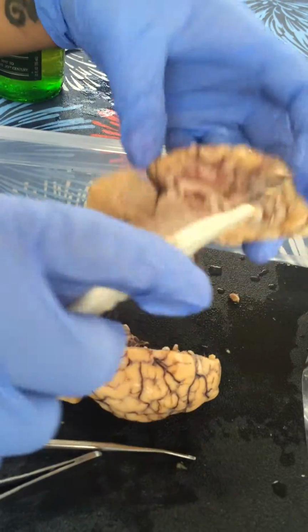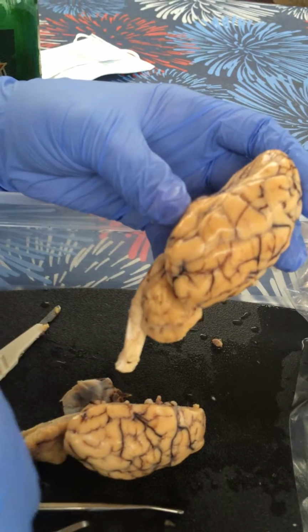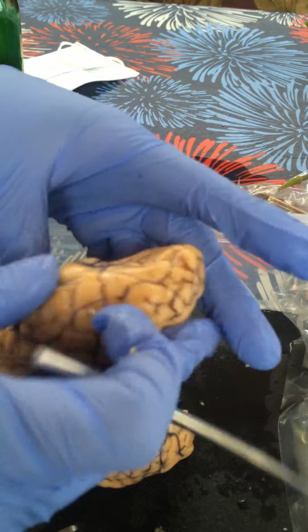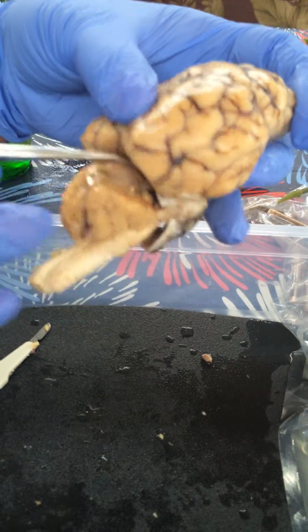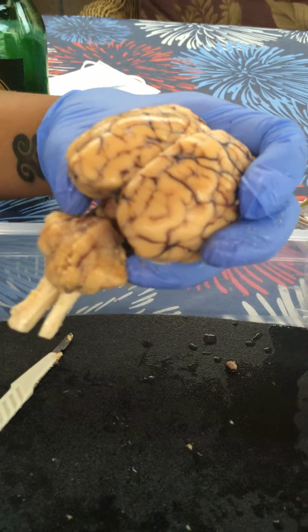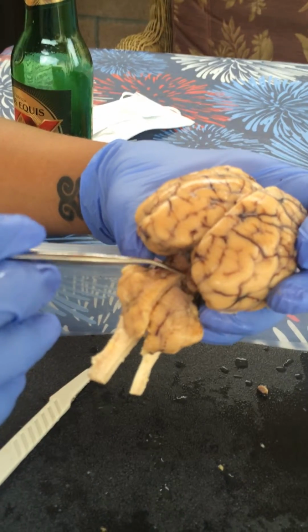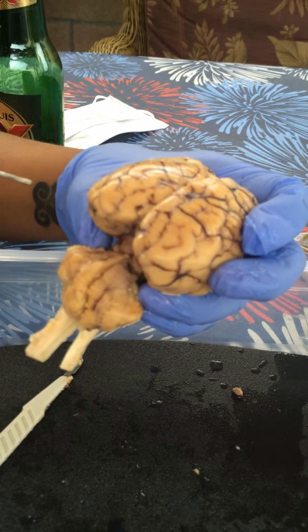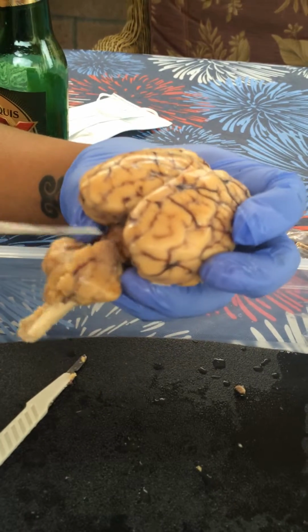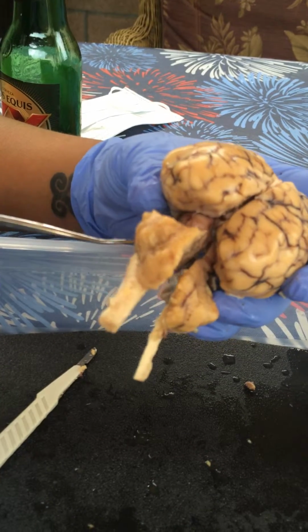Okay. So the midbrain area would be here on both sides. It's all midbrain. And then we're going to have the corpora quadrigemina, which is, if we see right here, we pull this down, these four bumps would be the corpora quadrigemina. And then we have the superior colliculi, which are here and here, and inferior colliculi, which are the two bumps underneath here and here. So superior and inferior. And then the pineal body, which is the bump here.